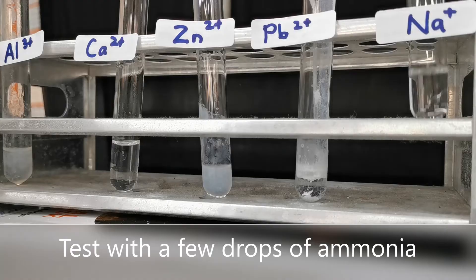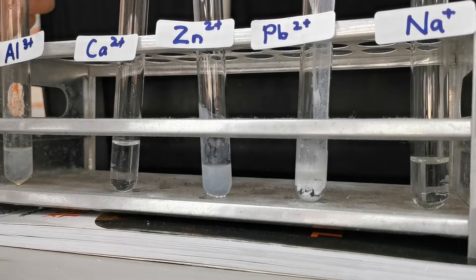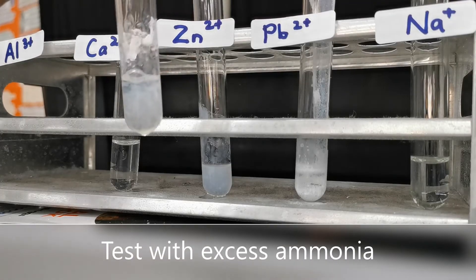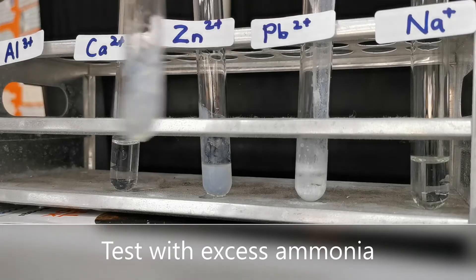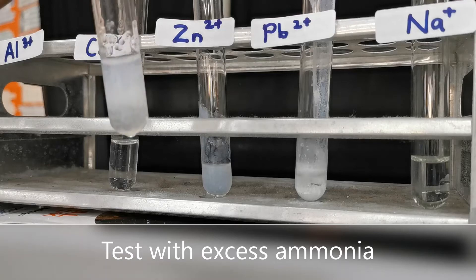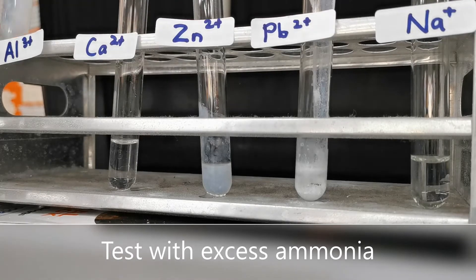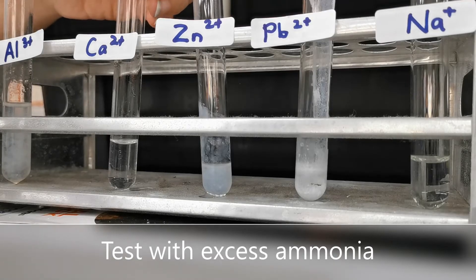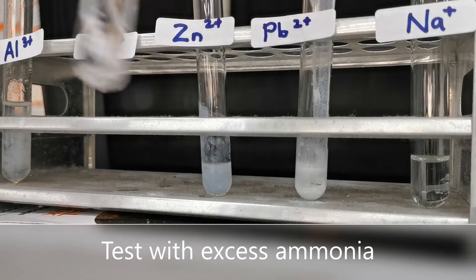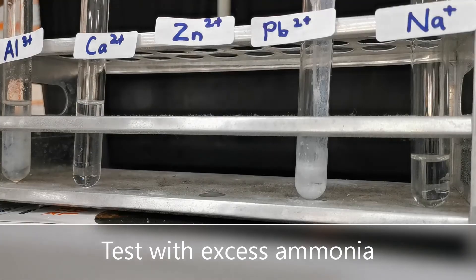Nothing happens with the sodium solution. Let's now add excess ammonia. The white precipitate in aluminum does not seem to dissolve. For calcium, when we add excess ammonia, it still does not form any white precipitate.